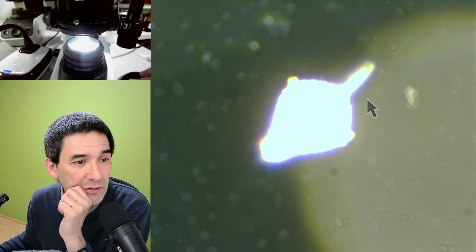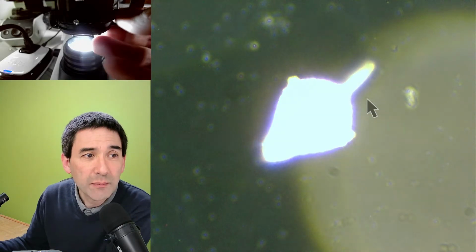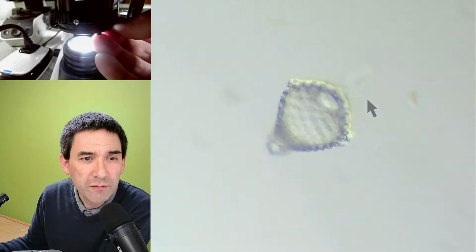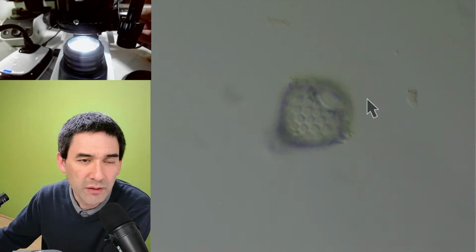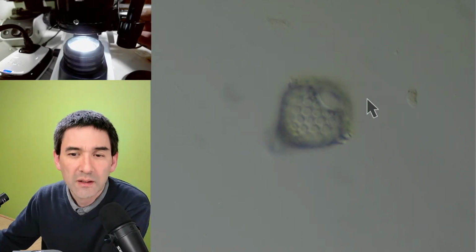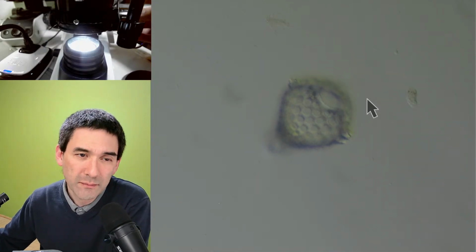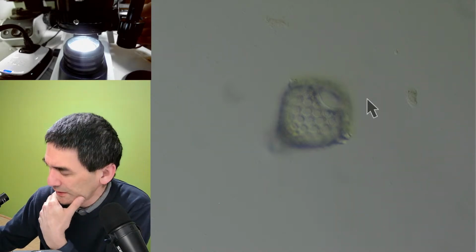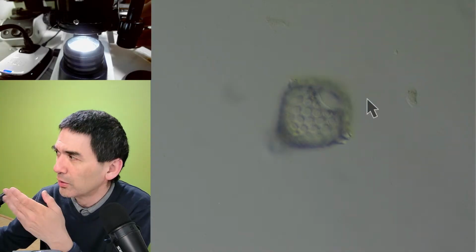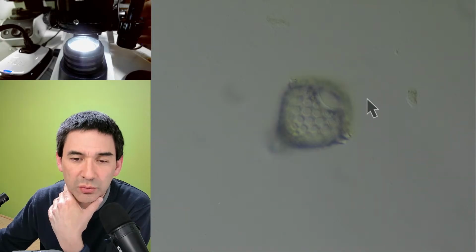That's just in the nature of the whole thing here, right? And that's why sometimes when you shift out the filter and go oblique, the light is a little bit more balanced out, and you are able to see the details. So that's the neutral density. I don't know if I make it darker. Generally, I'd probably have to play around with the camera exposure, but the settings don't allow me to do that, unfortunately.